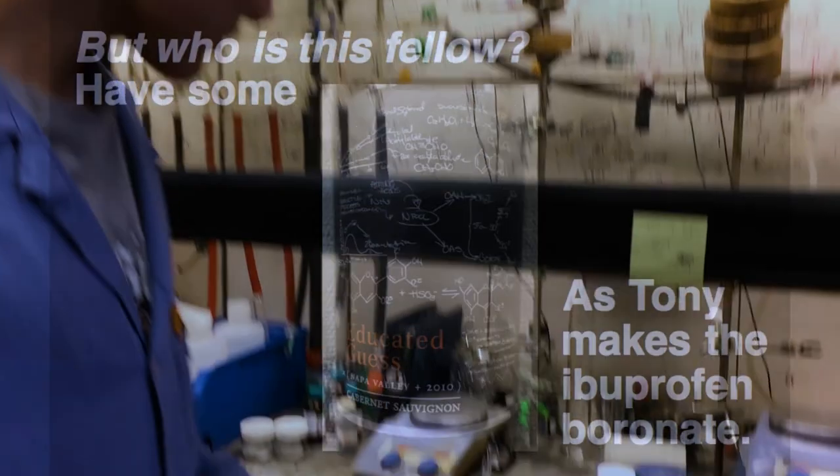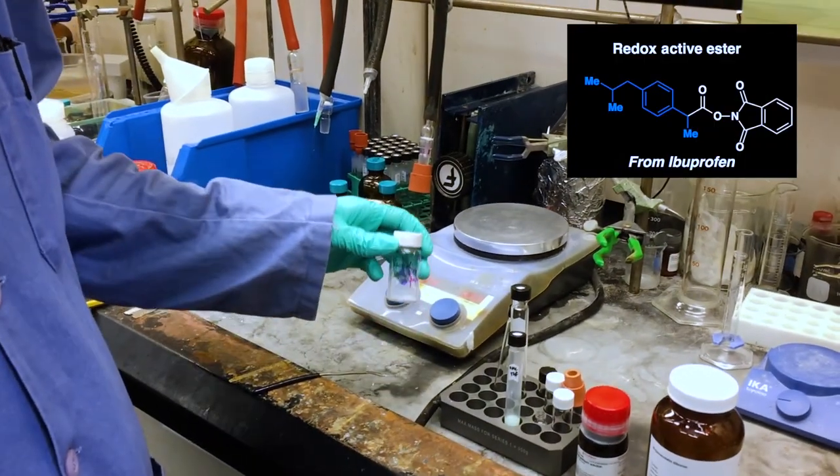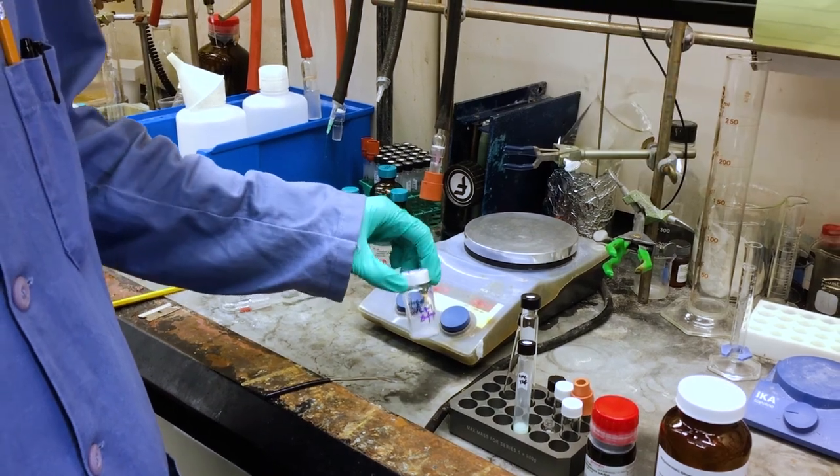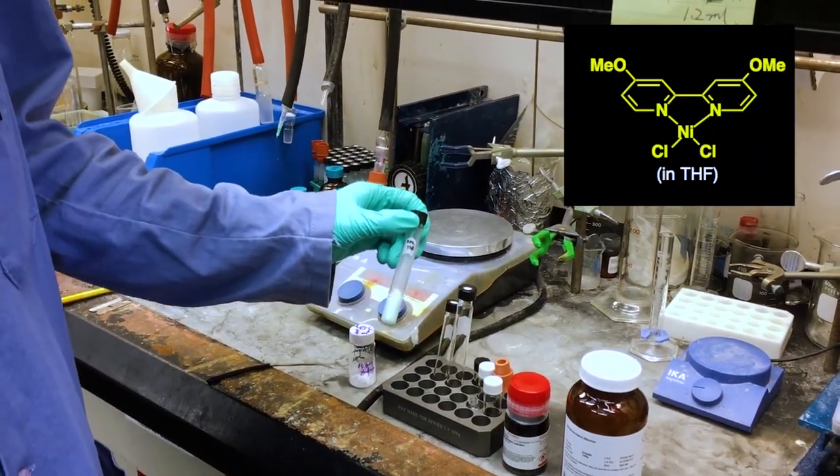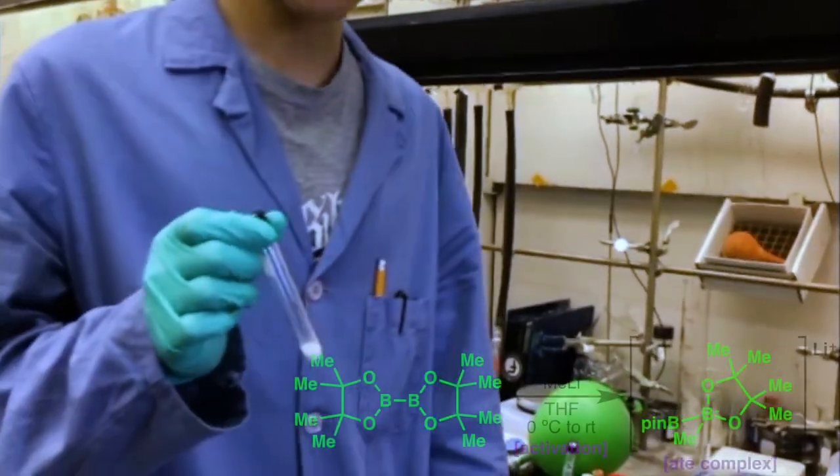Let's look at the starting materials. Here we have the redox active ester derived from ibuprofen, made this last weekend, as well as the stock solution of nickel and ligand. Here we have the new tube.